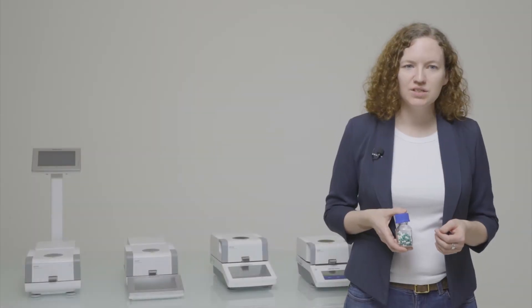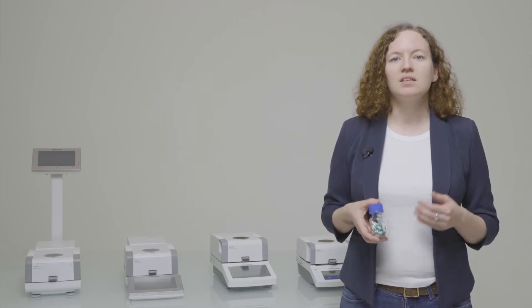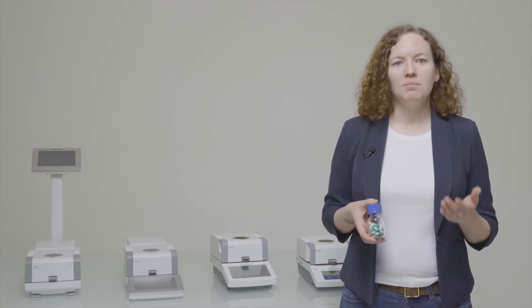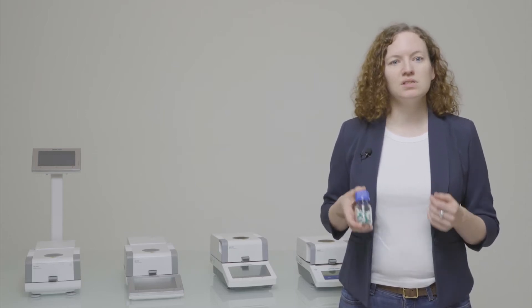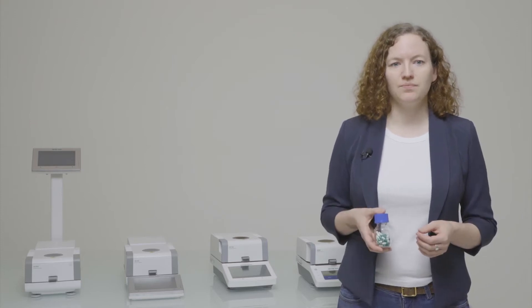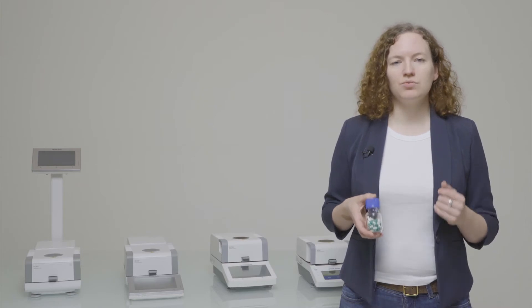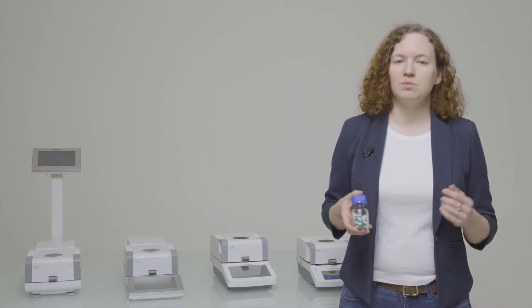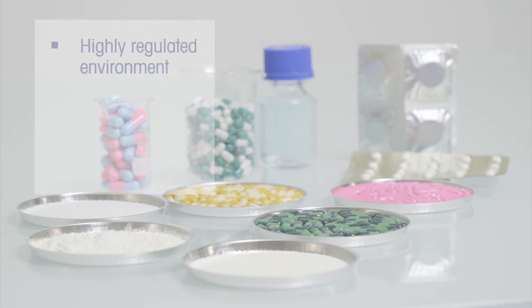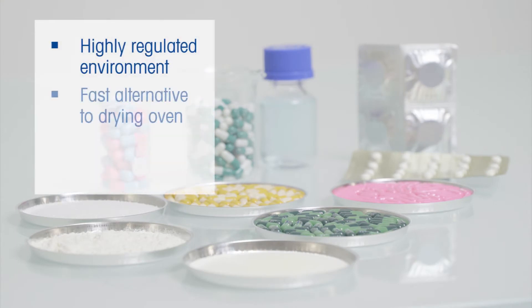In the pharmaceutical industry, moisture content determination is an important step in many processes, such as manufacturing of tablets or capsules, or quality checks of the finished drugs. But which instrument is the best solution to get accurate results with a safe and traceable process? Let's say, for example, that you work in a highly regulated environment.